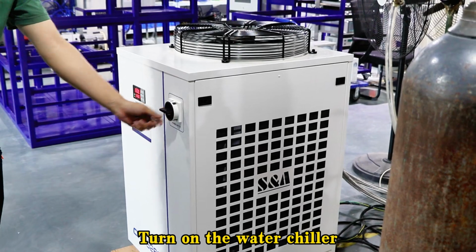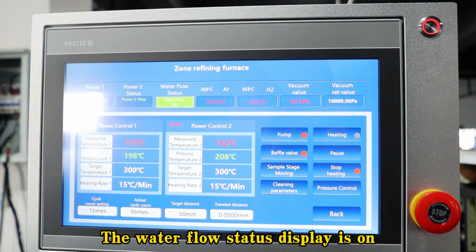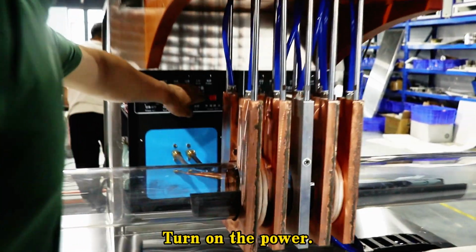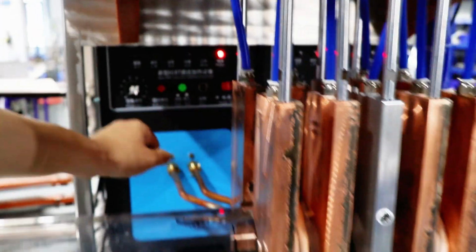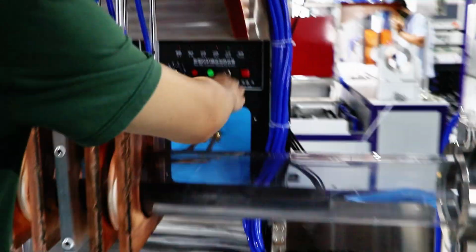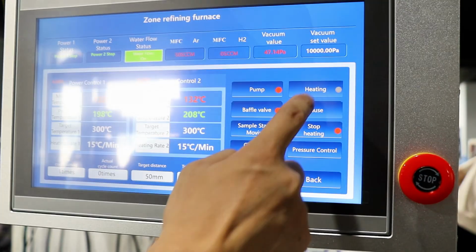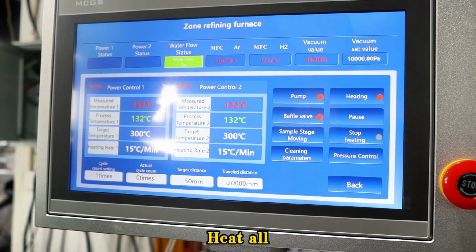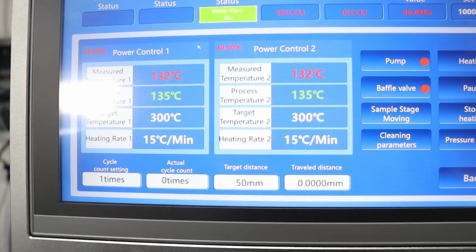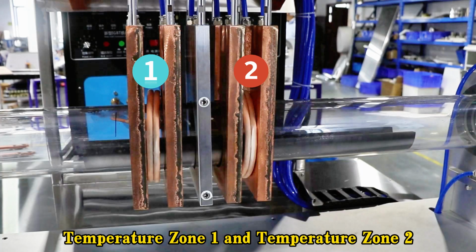Turn on the water chiller. The water flow status display is on. Turn on the power. Click to heat up. Heat all. Temperature zone 1 and temperature zone 2.